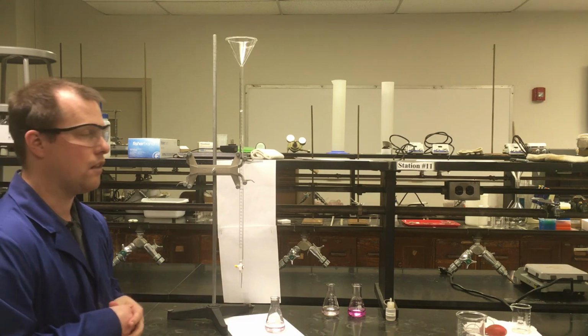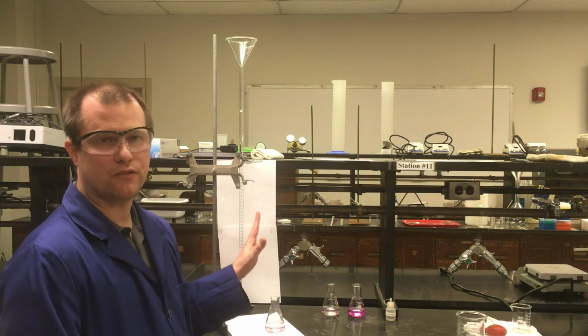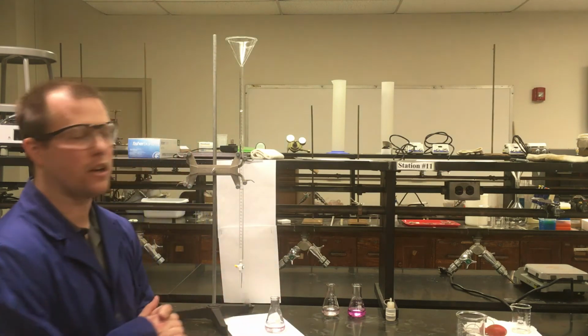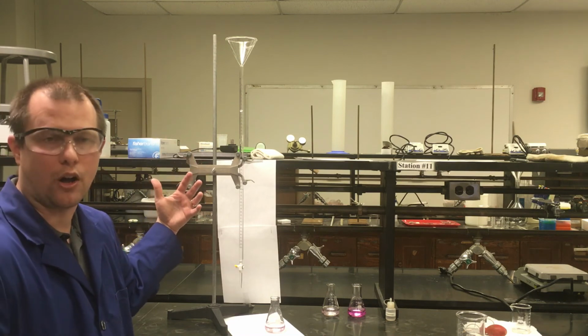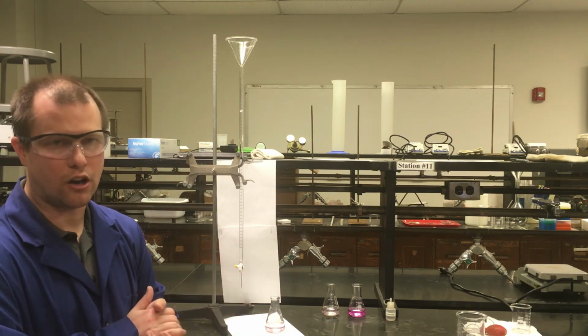Last couple quick notes, things like waste and safety. From a safety perspective, with titrations we're pretty much always dealing with acids and bases. So we always want to be careful in terms of their general handling. Gloves, not a terrible idea, although these concentrations are very small that I'm particularly working with right now. So if I get a little bit on my hand, not the end of the world, I can just wash it off, it's going to be okay.